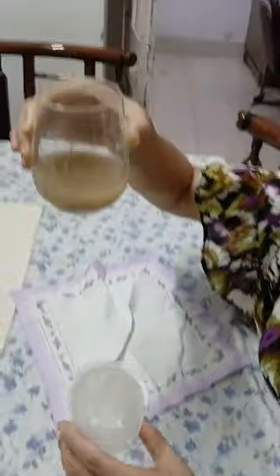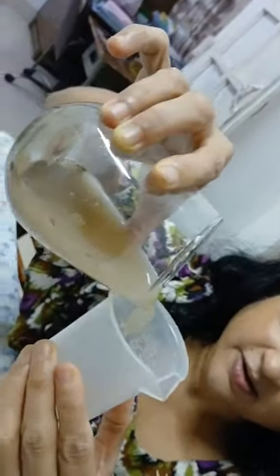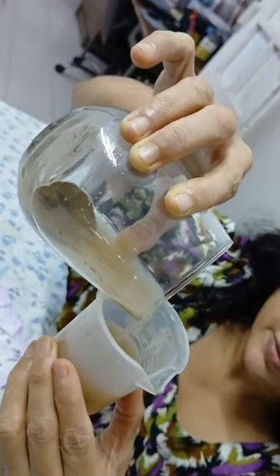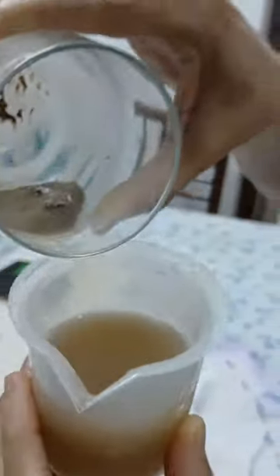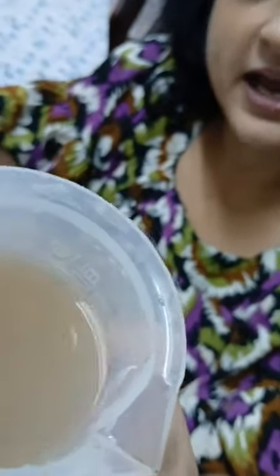This is the liquid, and I am going to gently tilt and pour this upper layer into a beaker. So my dear students, you can see that this upper layer, which was settling down, has now been transferred by me into a beaker. Now this is the upper layer that has been separated by the decantation method, and this is the solid material, the insoluble mud particles, which is the sediment settling at the bottom of the glass.